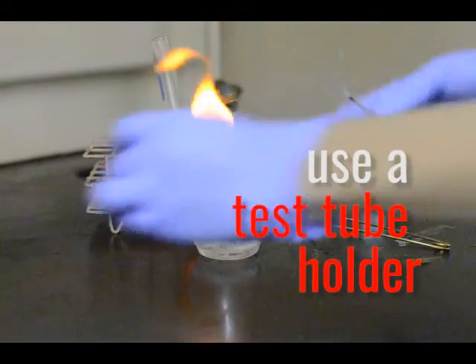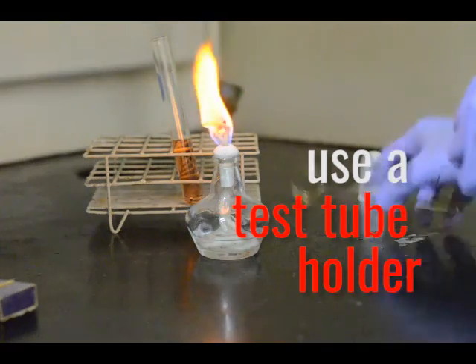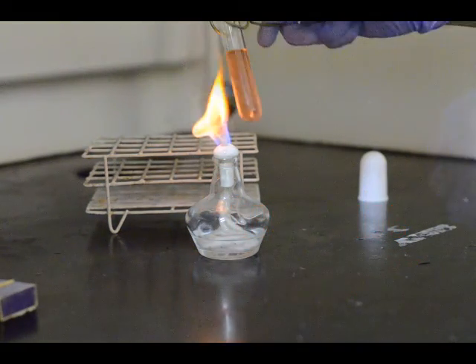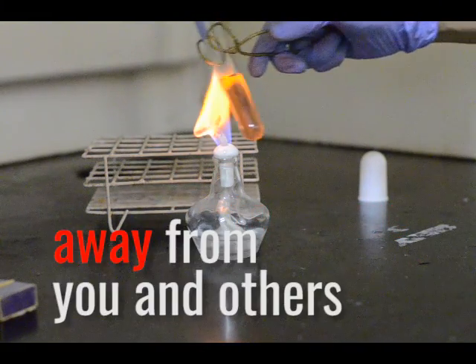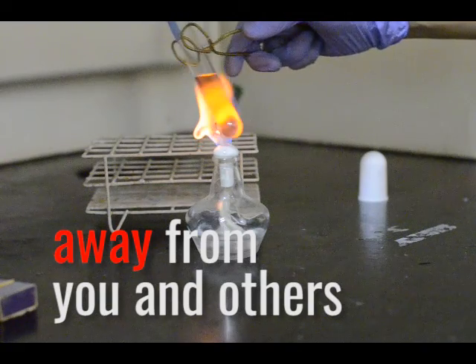He uses a test tube holder when heating small amounts of liquids in a test tube. He positions the tube angled away from another person, or himself.